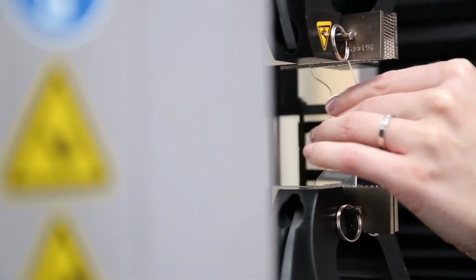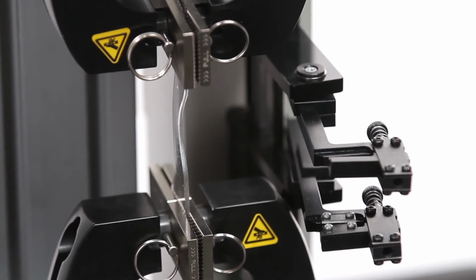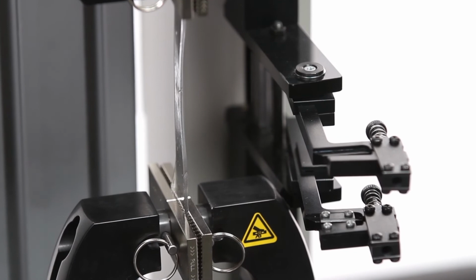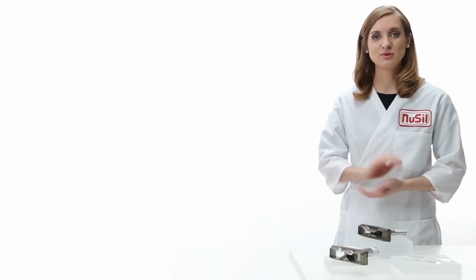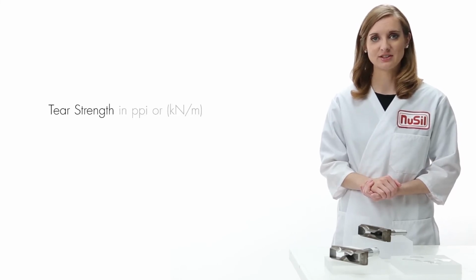For tear, we test the bar with an intentional defect. We place the material into the clamps, and the instrument pulls the sample again at a constant speed until the material tears. The exact moment that the material tears is the reported tear strength, which we give in pounds per inch. The tear strength for this material is 45 pounds per inch.